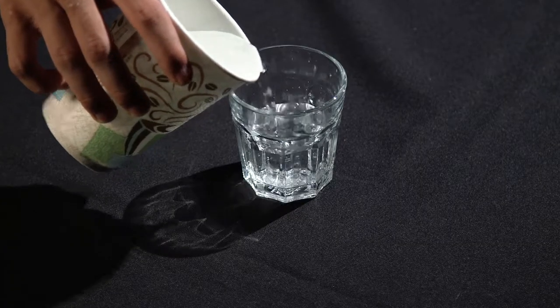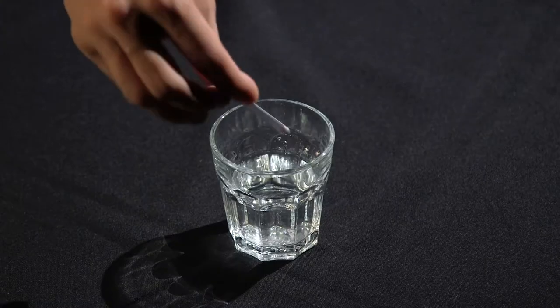Now, pour at least four ounces of water into your water container. Take a copper test strip and dip it in the water.